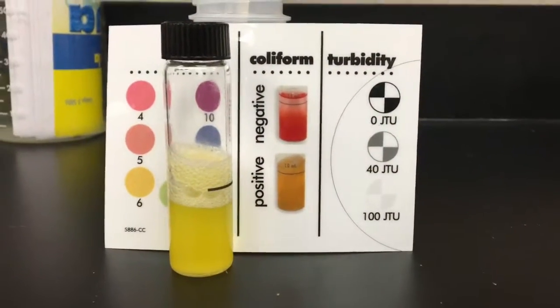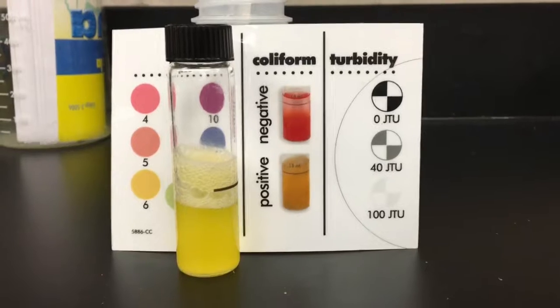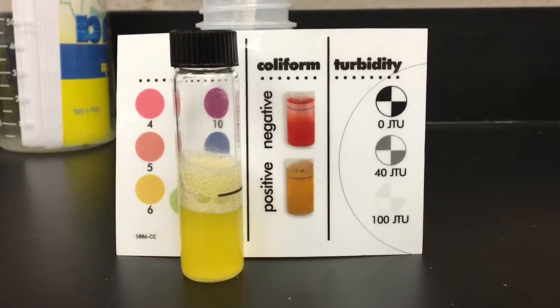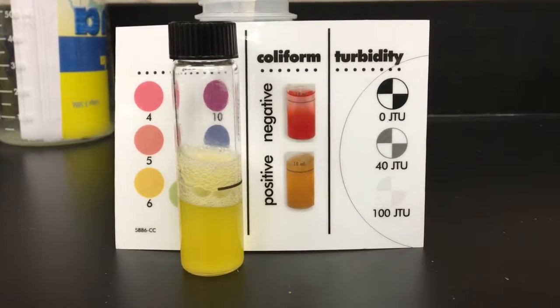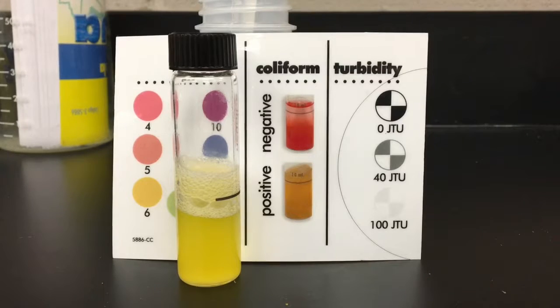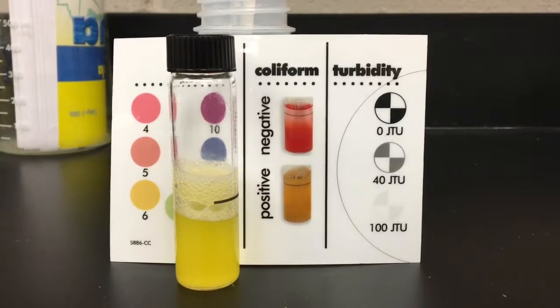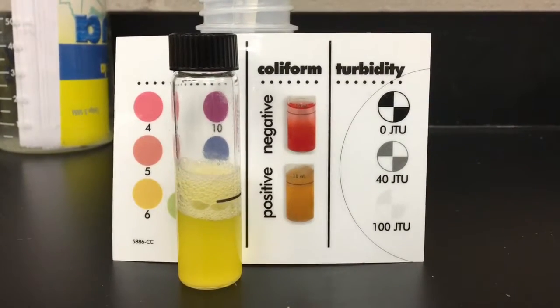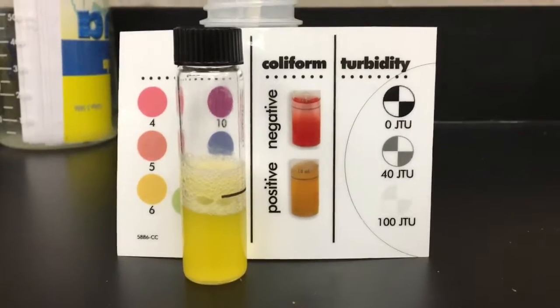The final test we did on our water sample was to test for coliform, and as you can see it's definitely positive for coliform. This is not an unexpected result because all sorts of fish, turtles, frogs, aquatic birds, and mammals use that pond as a water source or habitat. Coliform is testing to see if there's feces in the water, and again we expected it to be positive.